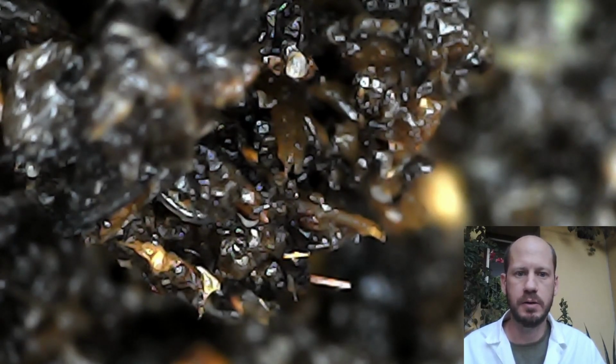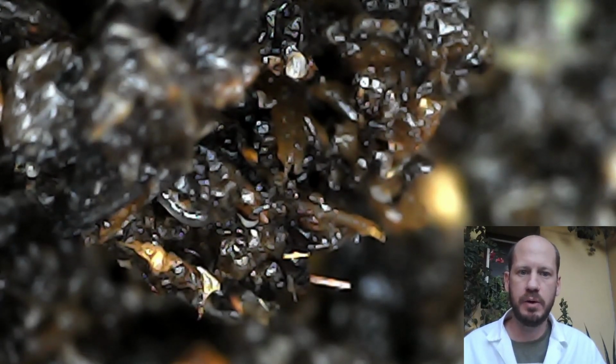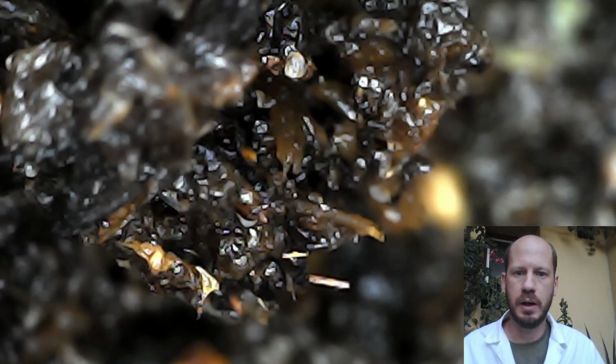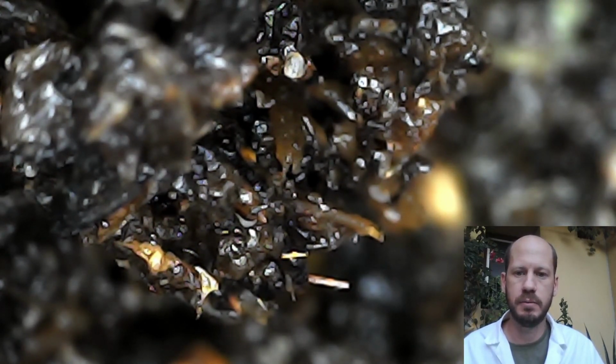So before I let you go, I wanted to show you this other tool that is very useful for soil microbiology, and I will come back and show you more images of this when we have the class of macro and mesofauna.